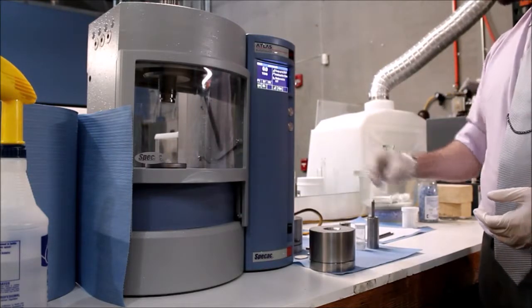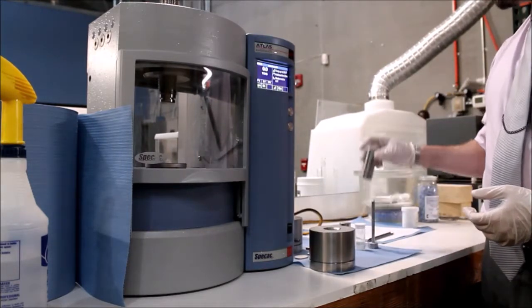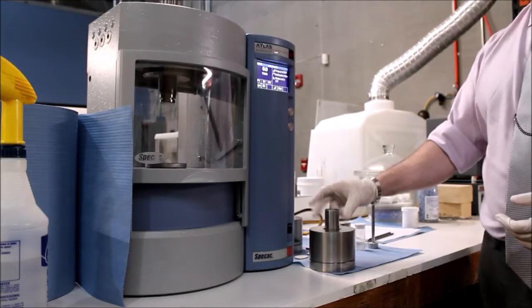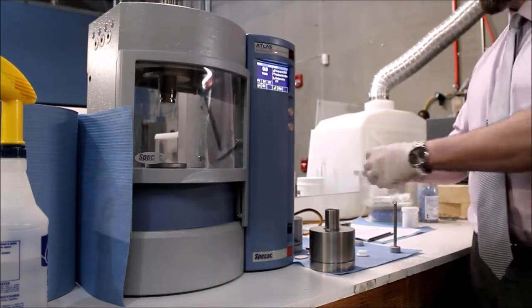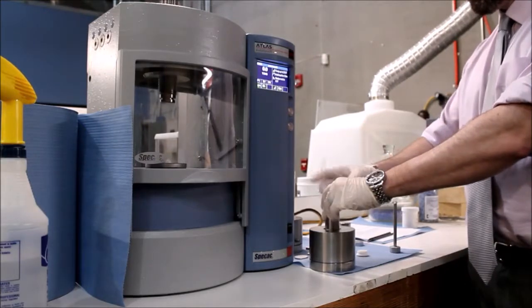From there, insert the aluminum cup and place the filling cylinder inside the bore. Insert the sample and compact the sample down using the filling rod.